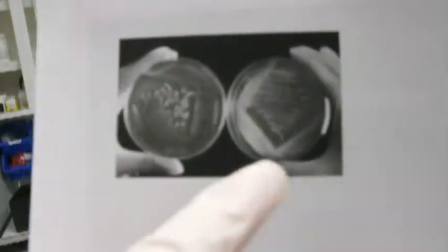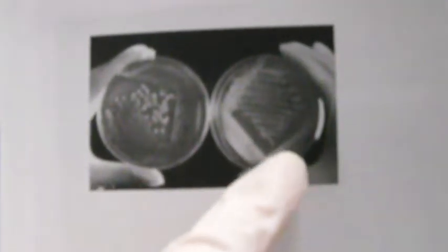So what I am going to do is just show some examples of different plates. As you can see, this is how we started out, and you can see that it's very different after 24-hour incubation. Here's another example. It's bubbly. This isn't in color, but this actually is a red blood agar plate, and the bubbles are actually brown. So that turned after 24 hours. Here's another example. You can see the progression of growth based on the white dots.